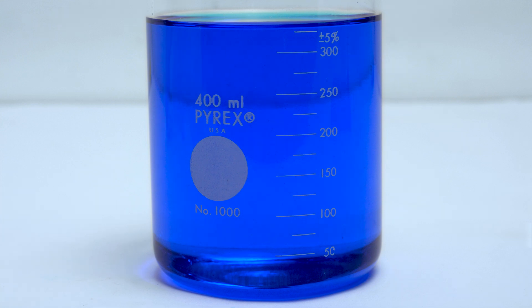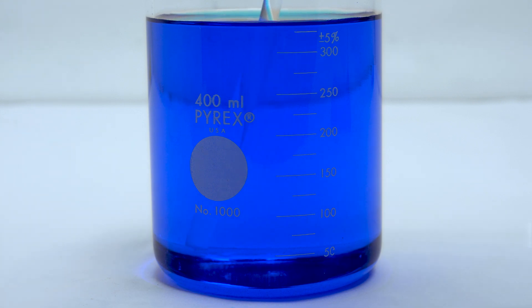This is a supersaturated solution of copper sulfate. It doesn't look too special, but watch what happens when I scratch the bottom of the beaker with a glass stir rod. Tiny crystals start to appear, seemingly out of nowhere, and continue to grow rapidly.